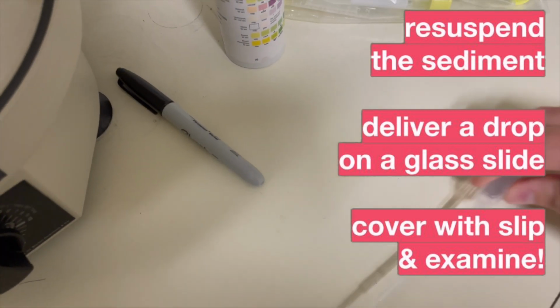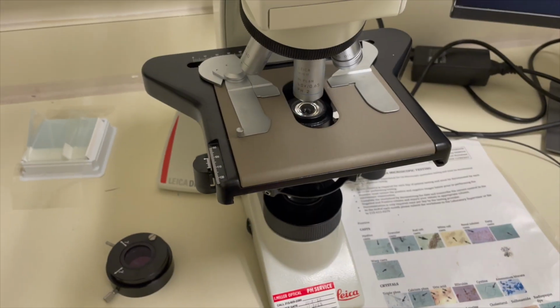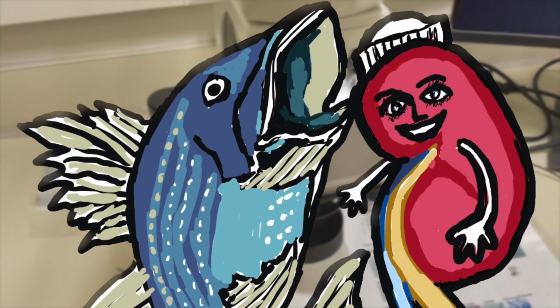And then you're going to take just 1 or 2 drops of the urine in this pipette and come over here and put a sample right onto that slide, throw a cover slip on this bad boy, and you come over here to the microscope and pop it in there to take a look at what you may see.